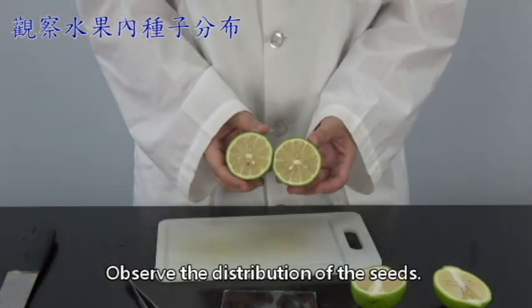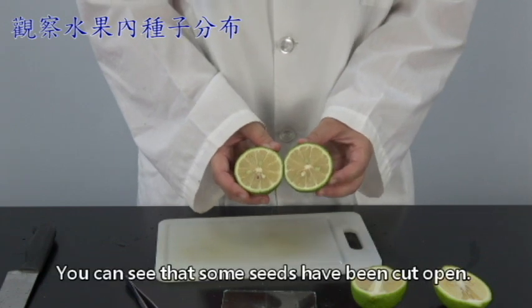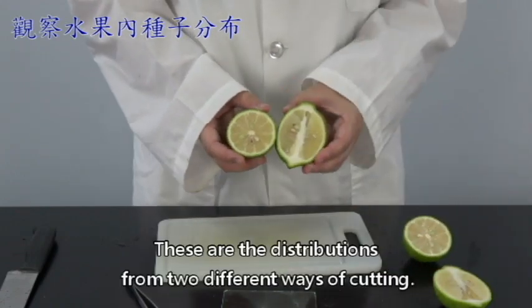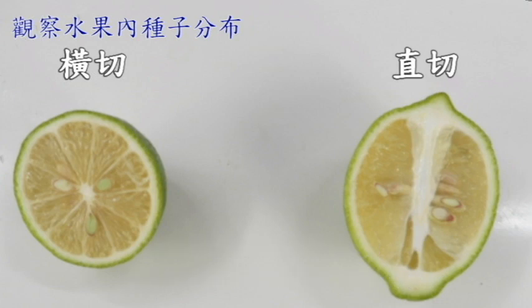Observe the distribution of the seeds. You can see that some seeds have been cut open. Later, we can also observe them together. These are the distributions from two different ways of cutting.